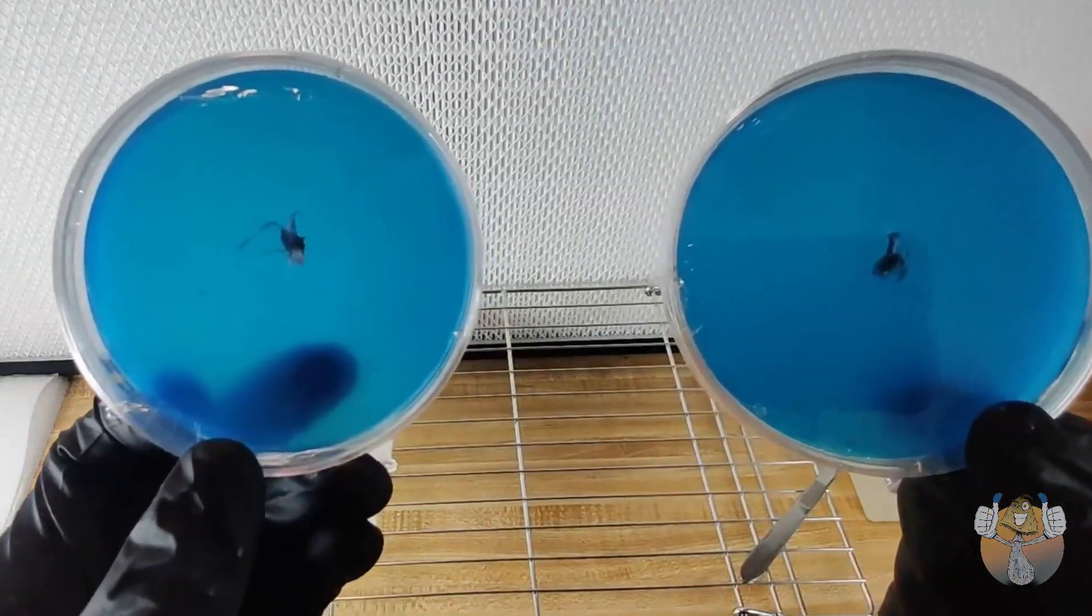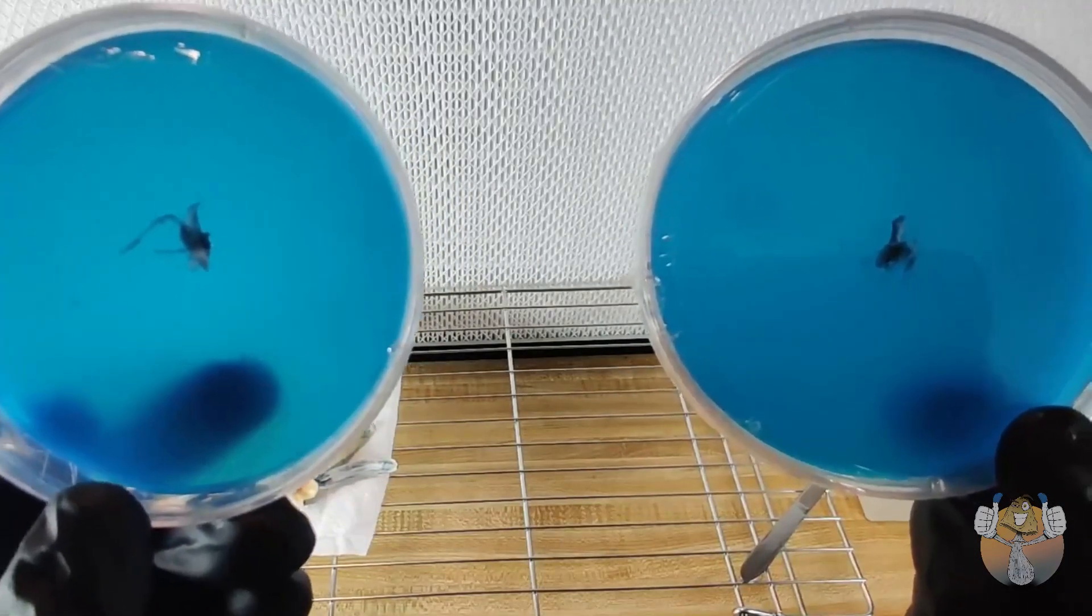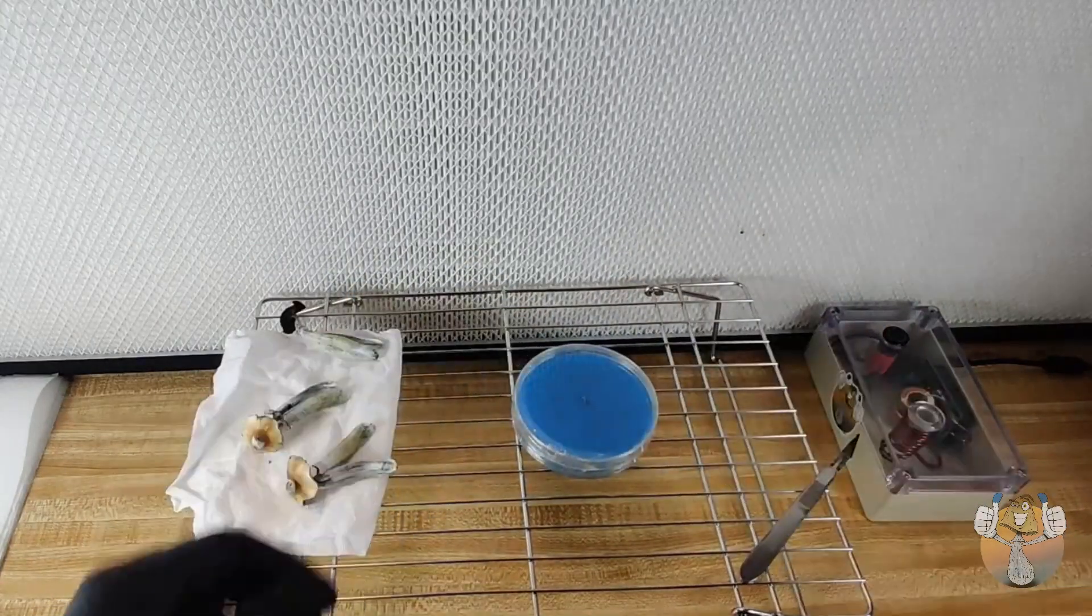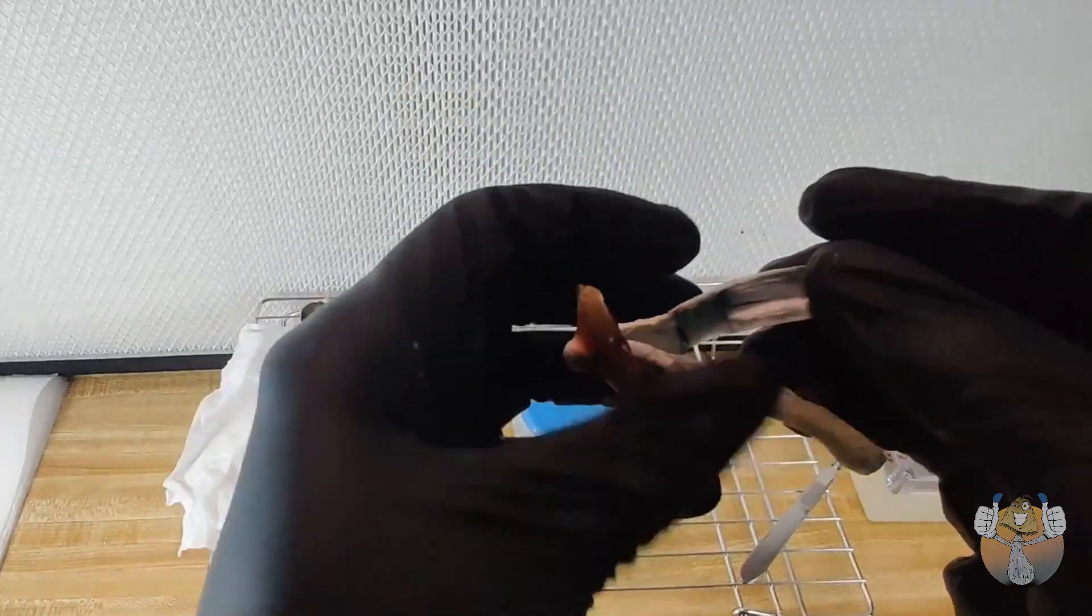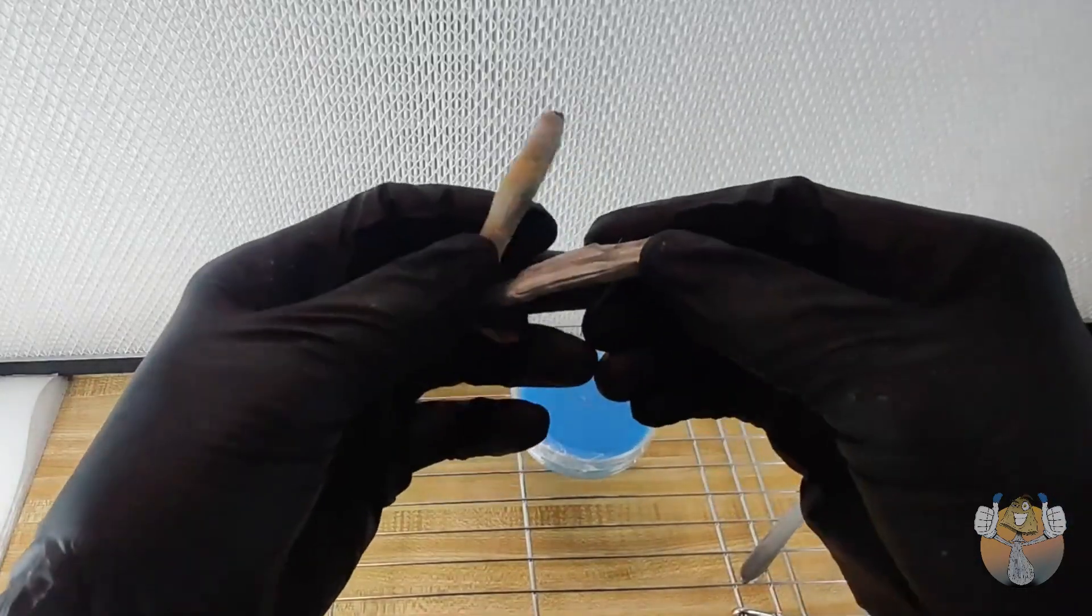And that's it. Very simple, very easy way to store your genetics and have a beautiful library of magnificent fruits.